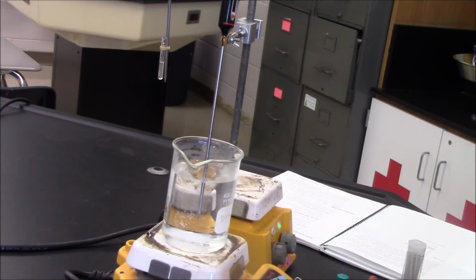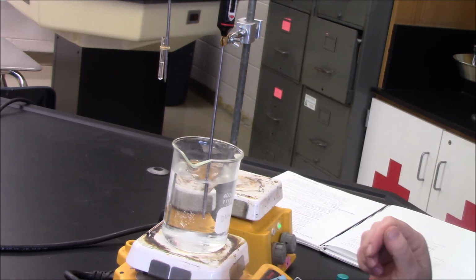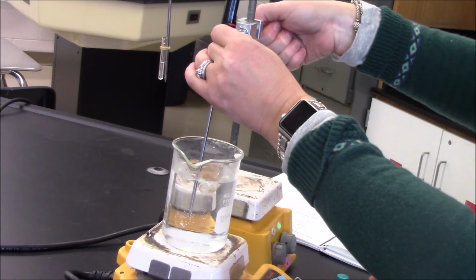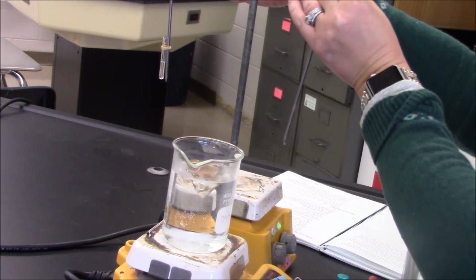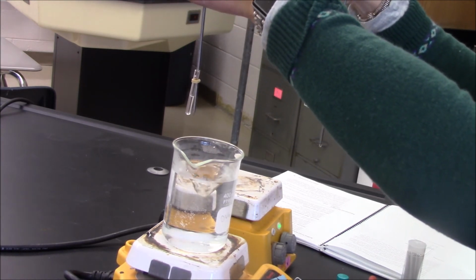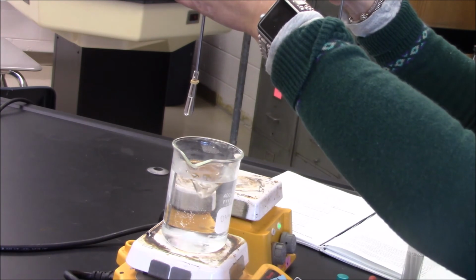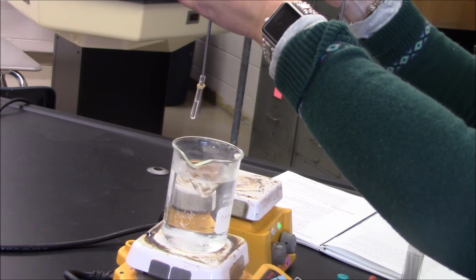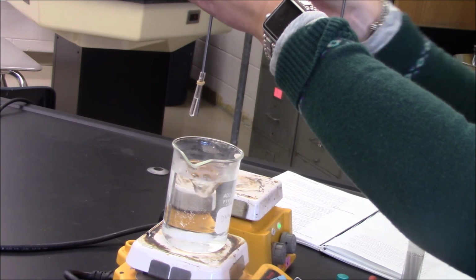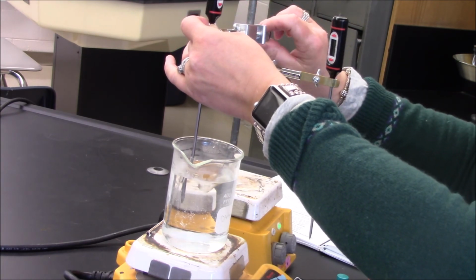Hey guys, we're back. I am ready to do my boiling point test. I've heated up my water bath. It's at about 55 degrees Celsius, a few degrees above the literature boiling point for our product. I'm going to move this thermometer out. And then over here, you guys can see, hopefully, that I've set up my boiling chamber. So I have my t-butyl chloride and my broken piece of capillary tube and my microscale test tube. And I'm going to try to lower it in. And hopefully it should start to boil.